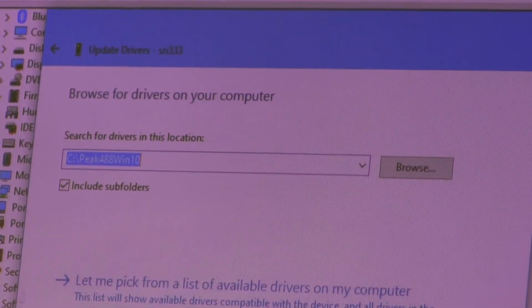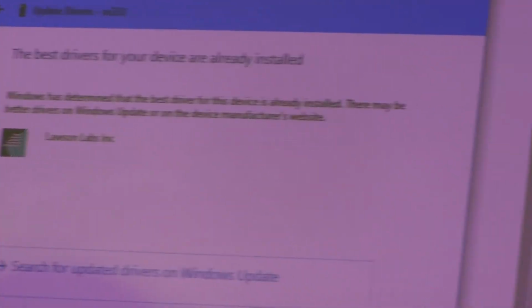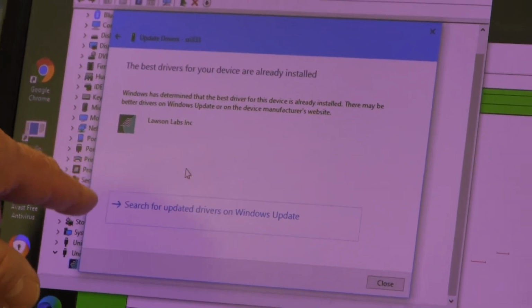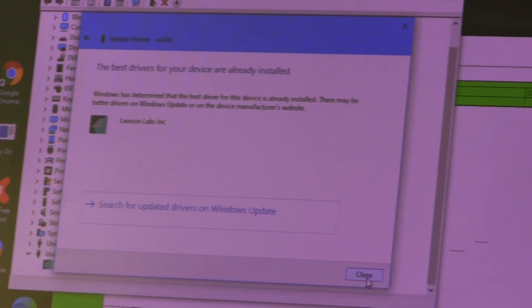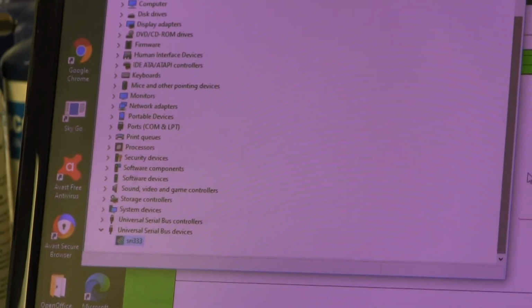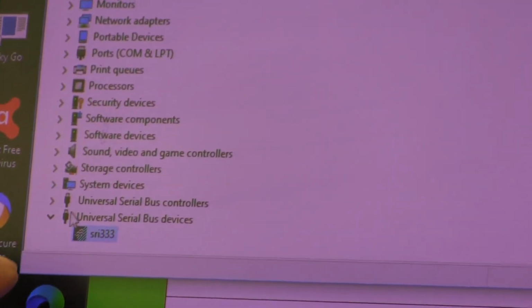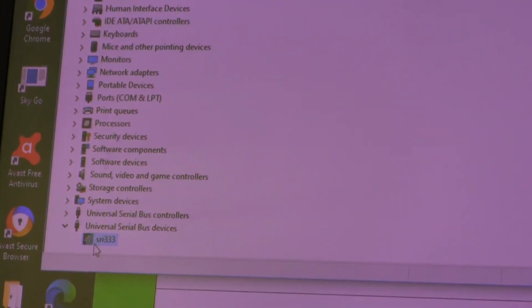You just have to identify the folder that it's in, and then you click Next, and then it'll either say the best driver is already installed if it's correct, or it will install the driver from Peak Simple. So at that point, you go back to the device manager screen, and you should successfully see this icon with no yellow triangles.